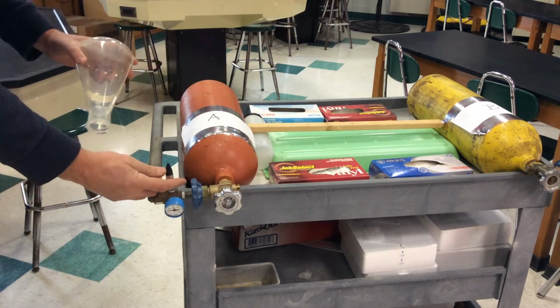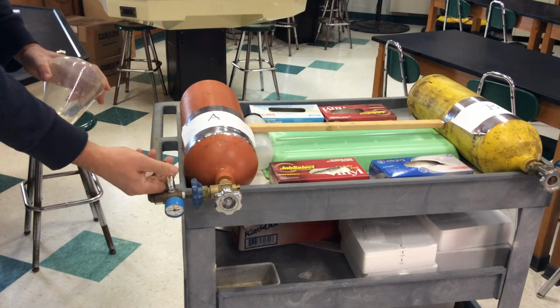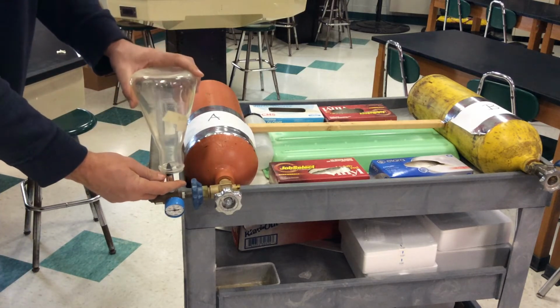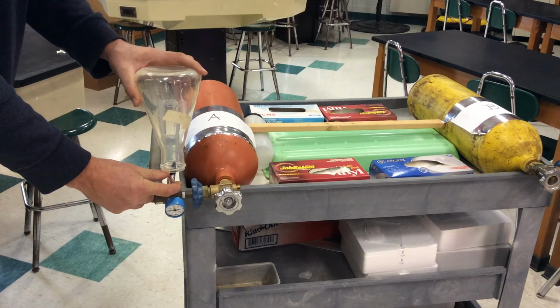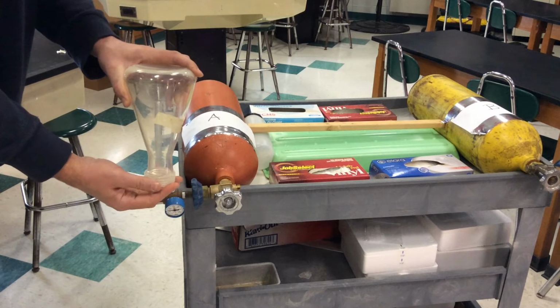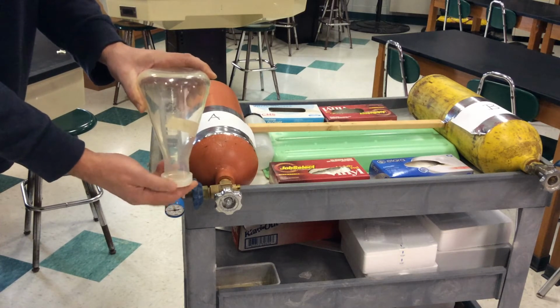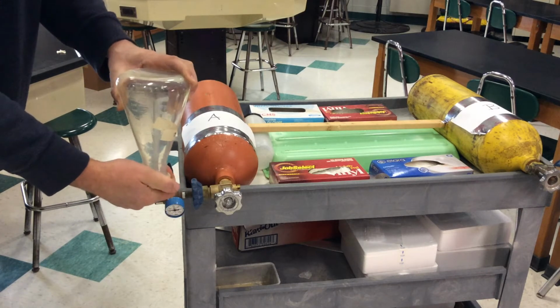And now you can see that by bending this, which is called a balloon valve, bending it backwards, forward, the gas comes out. So I'm just going to put this over, and using my thumb, just bend it. And wait 10, 15 seconds. And then immediately put the top on. Notice I keep this flask for gas A upside down. It's a gas that is less dense than air, so therefore it would leave the flask.